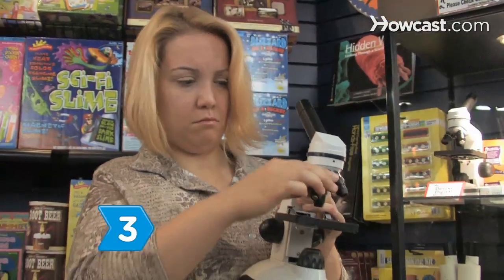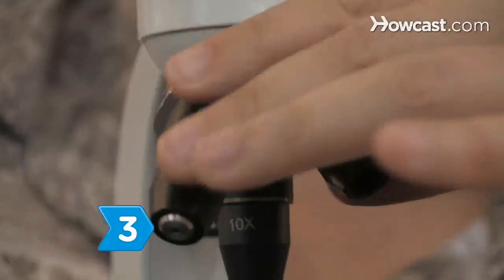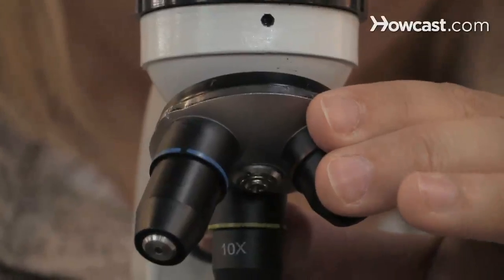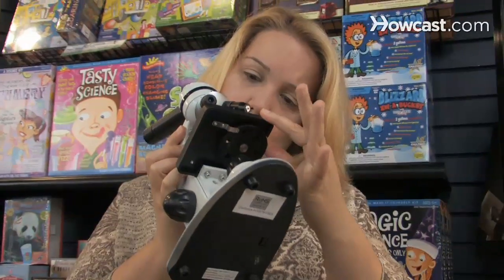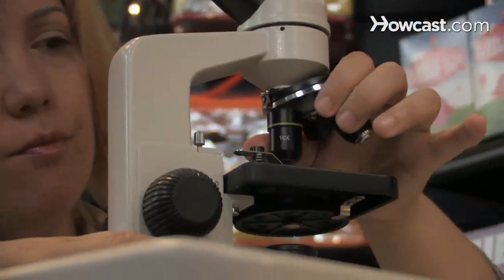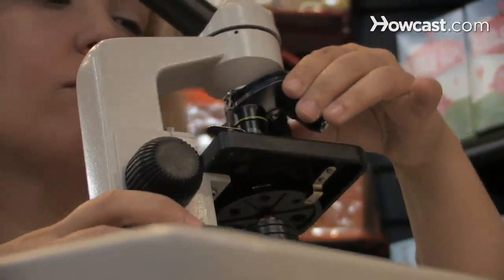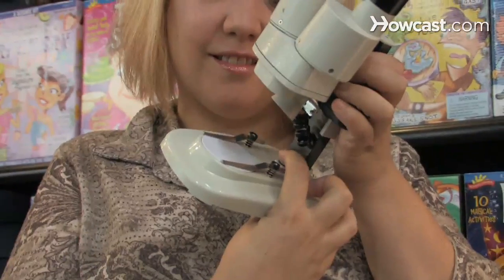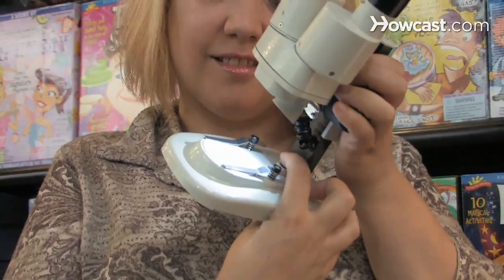Step 3. Examine features and mechanics, deciding on a compound model with magnifying lenses mounted in a rotating arm to view two-dimensional objects, or a stereo microscope with two eyepieces to view three-dimensional objects.